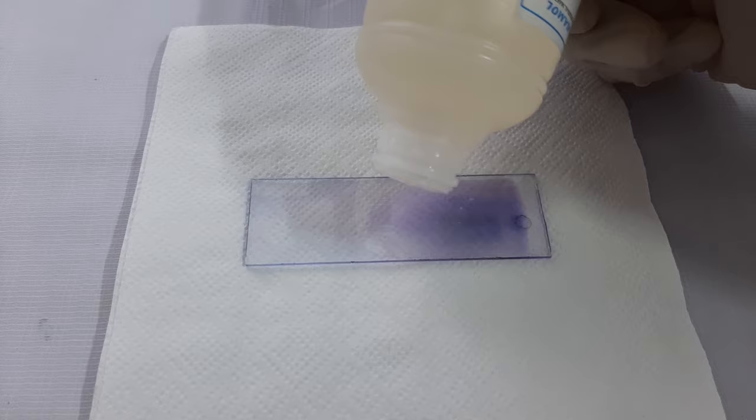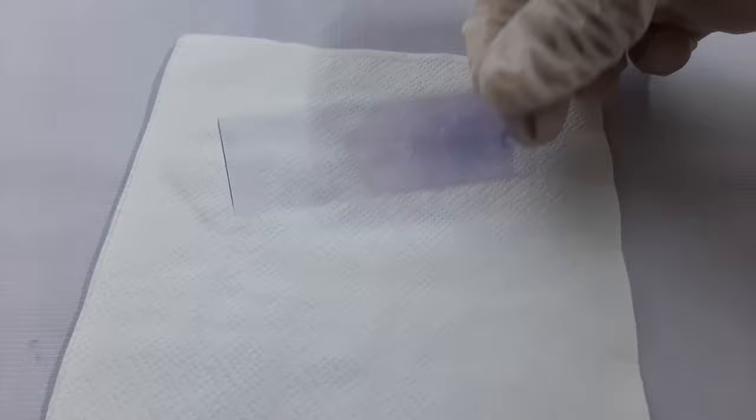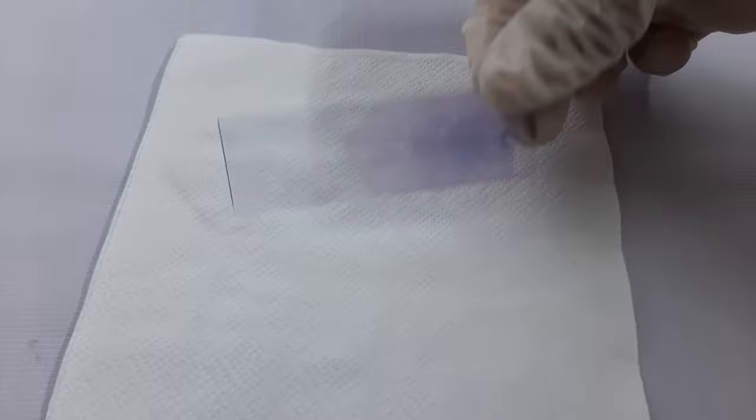Once the slide is air dried, add one drop of immersion oil on the thin side of the slide and focus the slide under the oil immersion lens of the microscope for additional examinations.